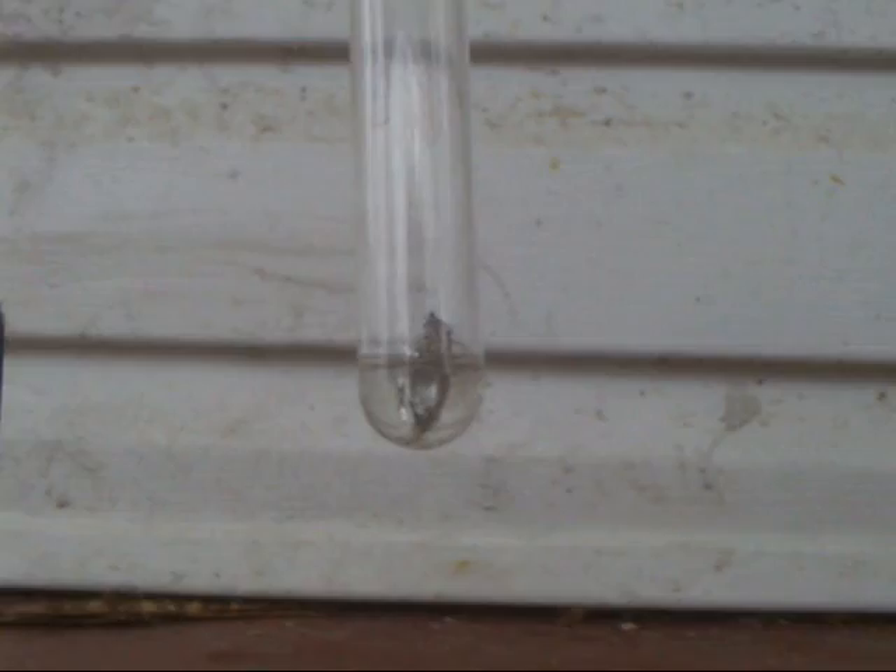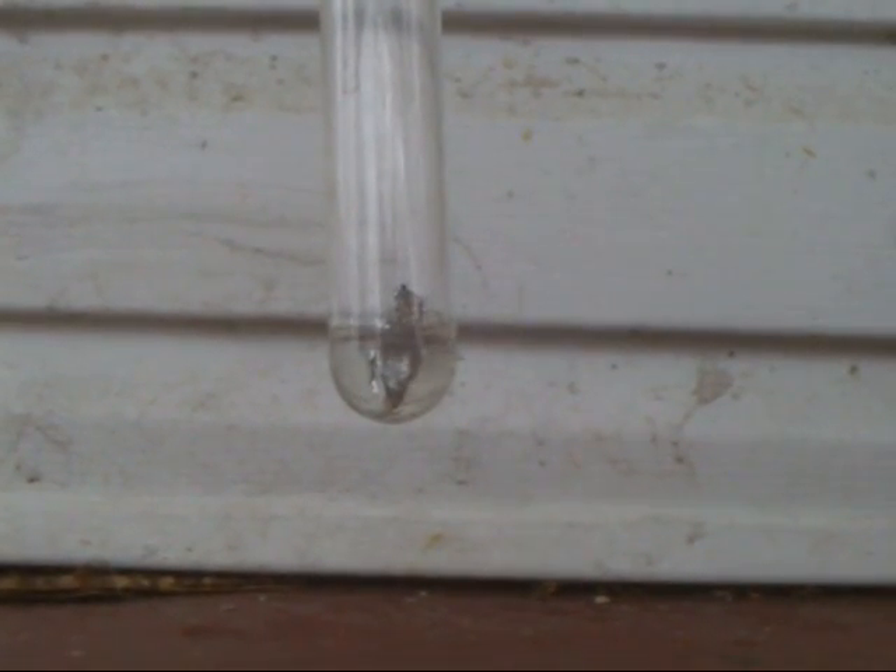Well, I would have done this in my lab if I had the fume hood. As soon as I add it, an immediate reaction happens. But my battery dies during the reaction, and I had to cut it.